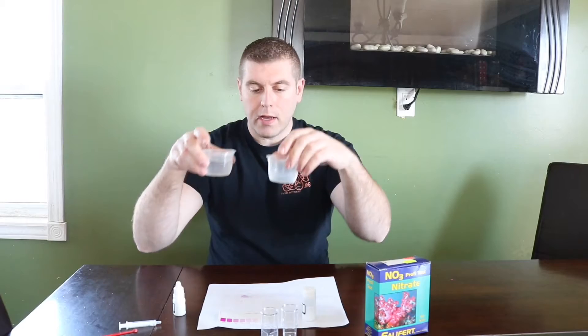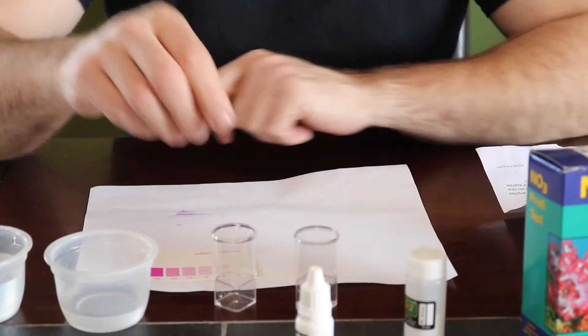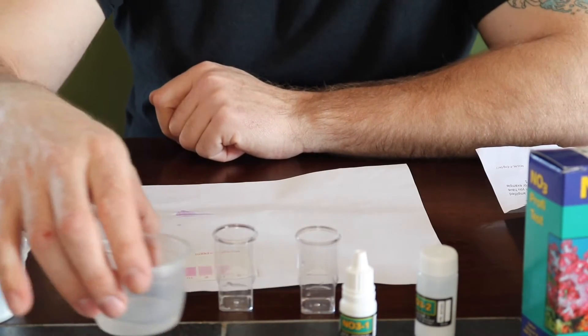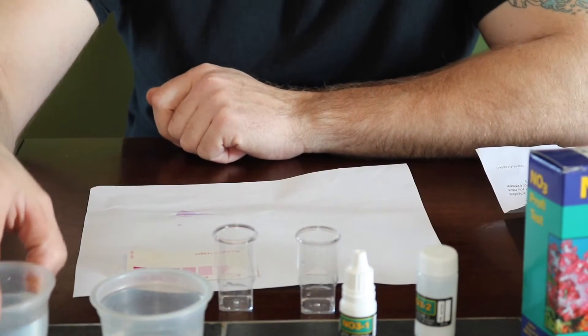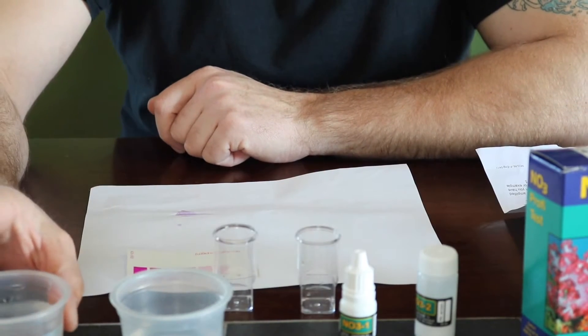So let's move in here quick and we're going to do this together and I'm going to show you guys the results. So here we go. So we got everything all laid out. We have our two test vials. We have our first sample of water and we have our other sample of water. So this one should be a really good test and this one should be a bad test.